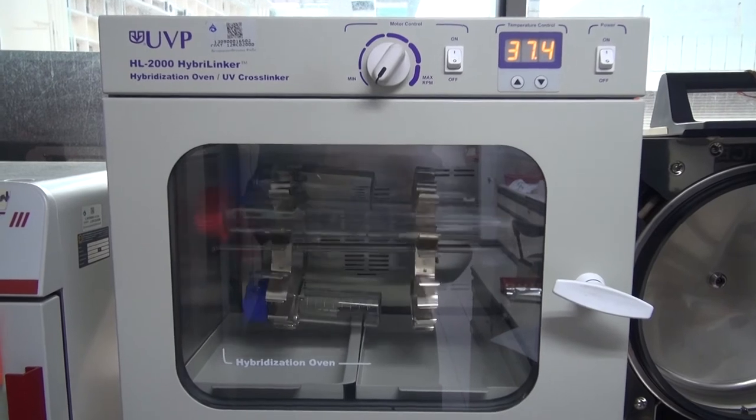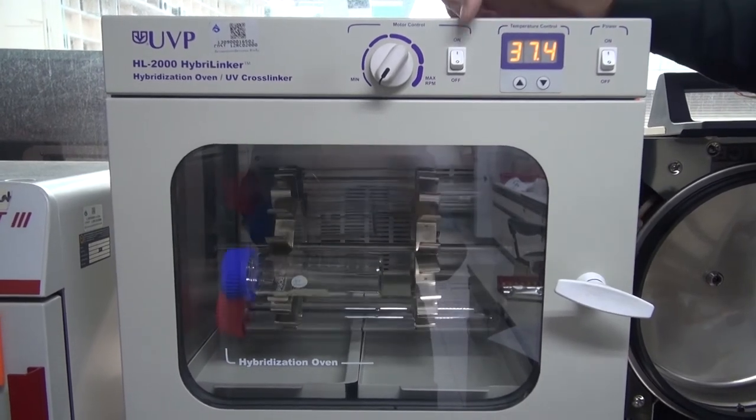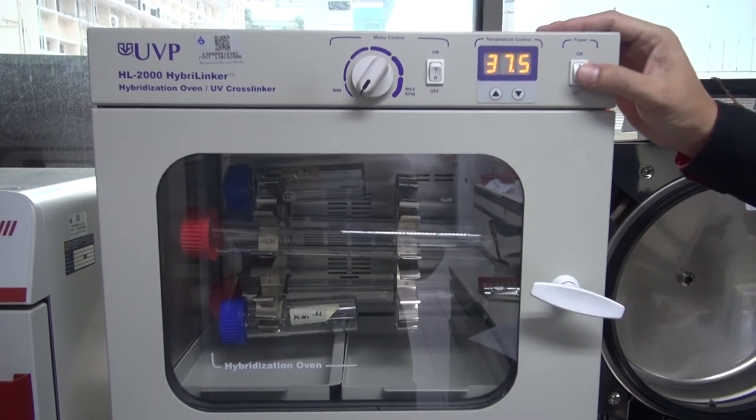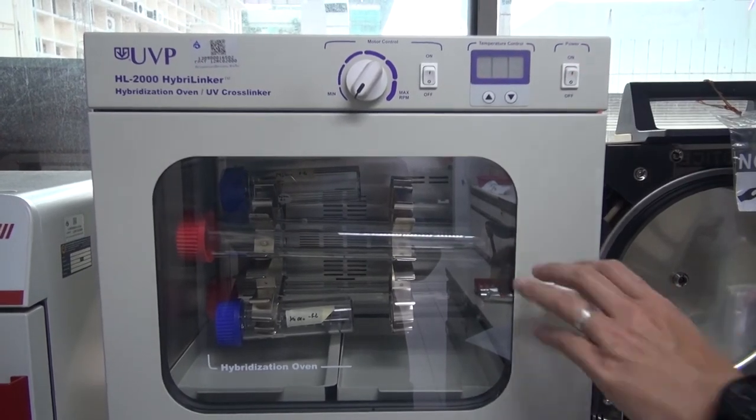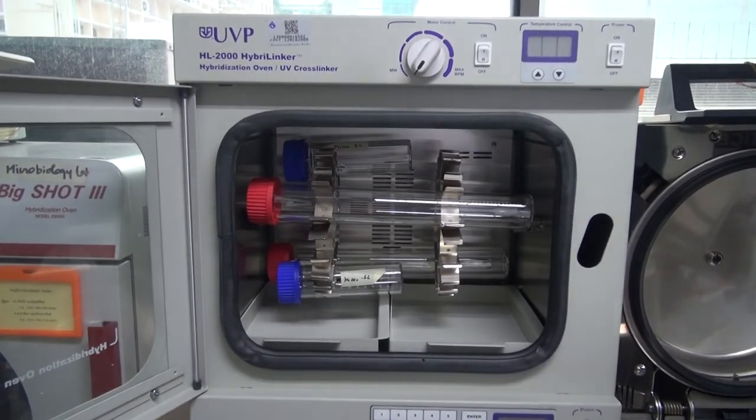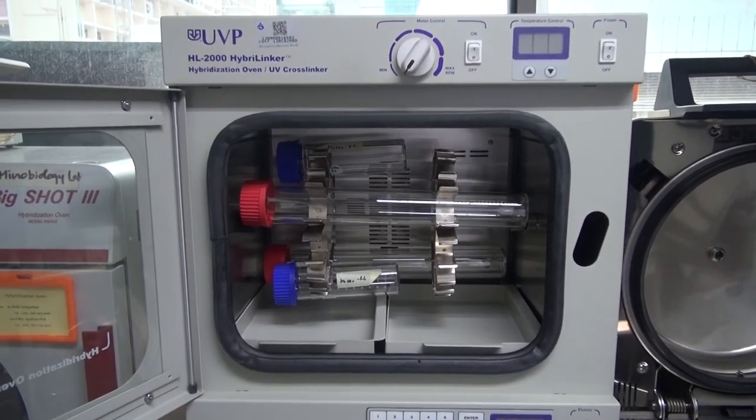After the experiment, the motor and main switch can be turned off. The bottle can be removed from the bottle clip one at a time.